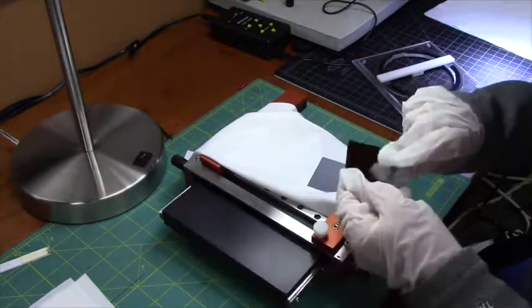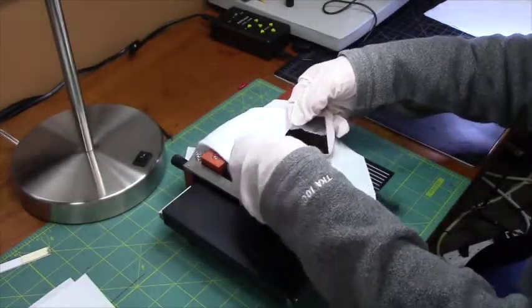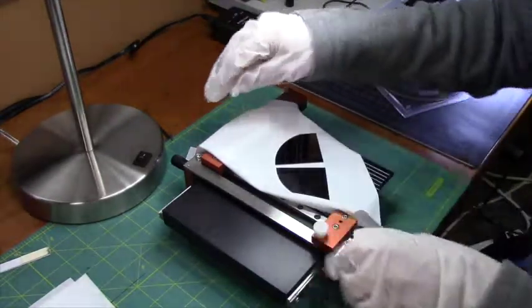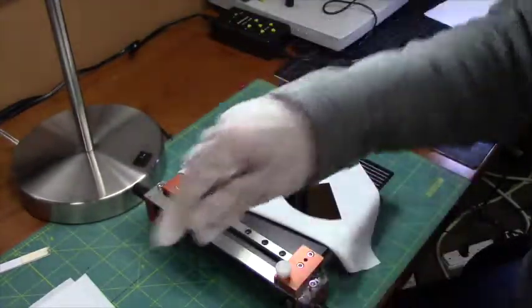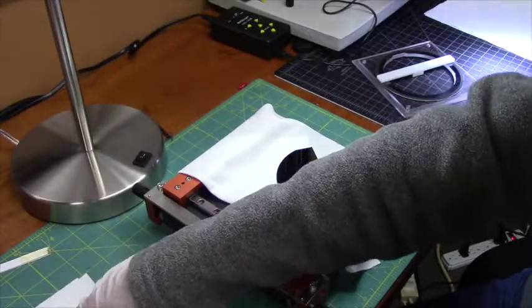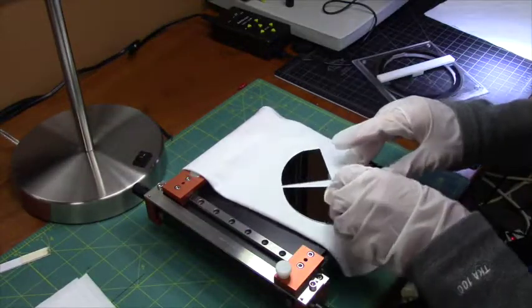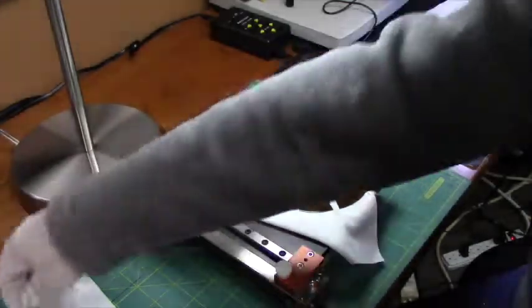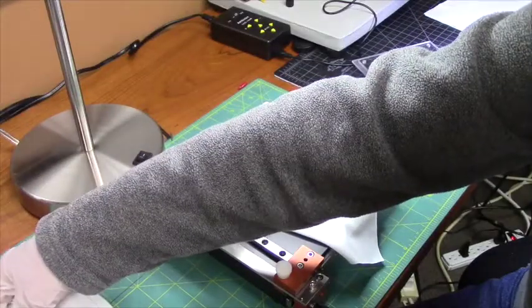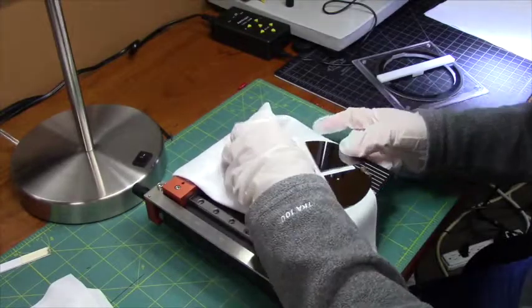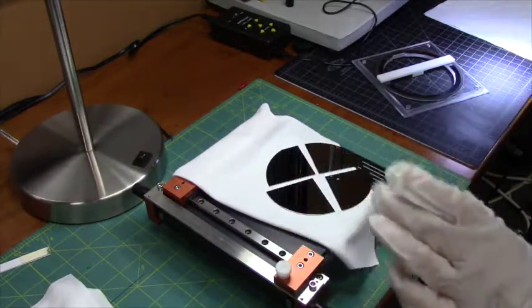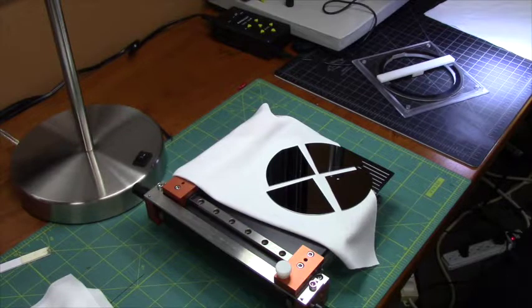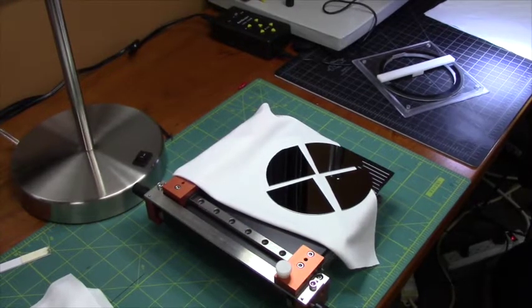And we have the other half complete, and you can show the four pieces.